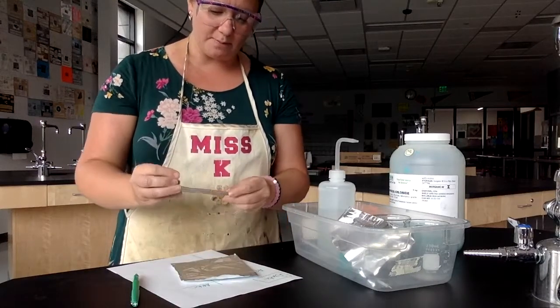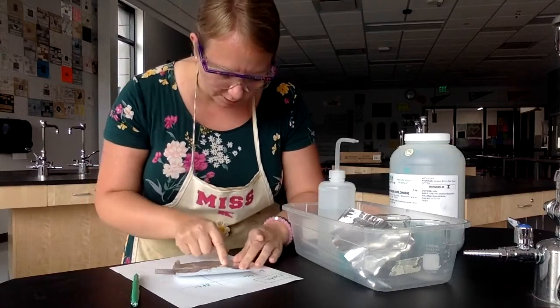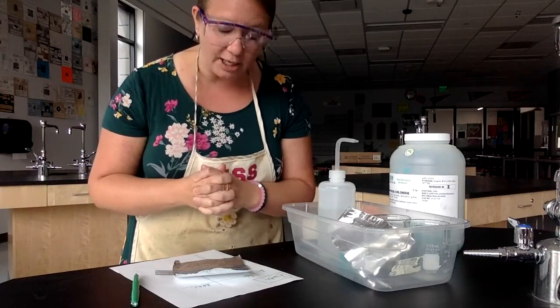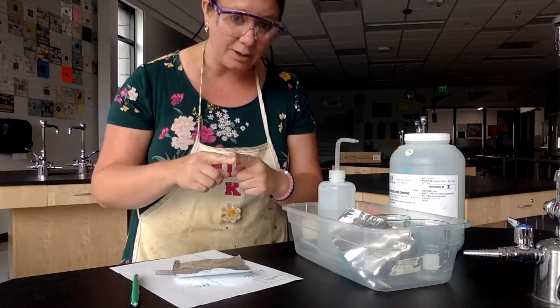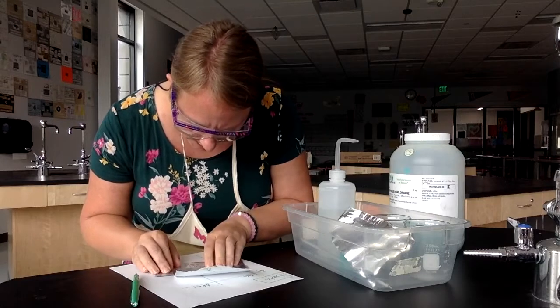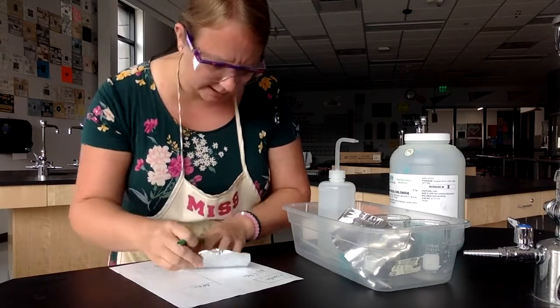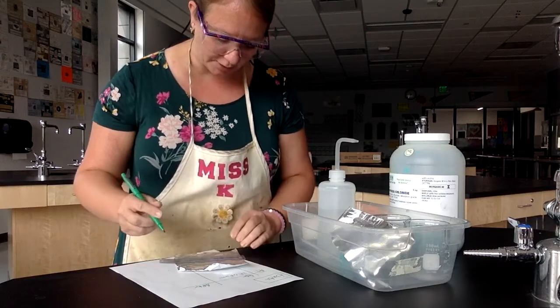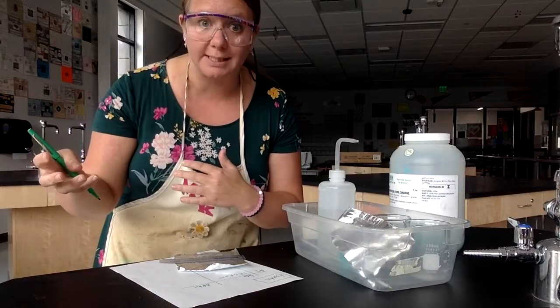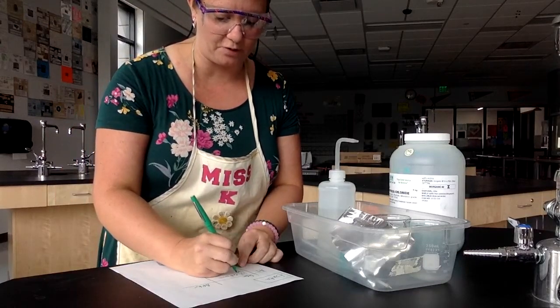I'm going to take a ruler and measure to the correct capability. I'm going to use the metric system — centimeters. My ruler is divided into centimeters, and there are 10 little lines between each centimeter, so it goes up by 0.1. That means I can read the tenths decimal place and report two decimal places. The width of this piece is 12.68 centimeters — make sure you have labels on your numbers. That means I counted 12.6, and the 8 after it tells me it was close to 12.7, but I could be a bit more specific.